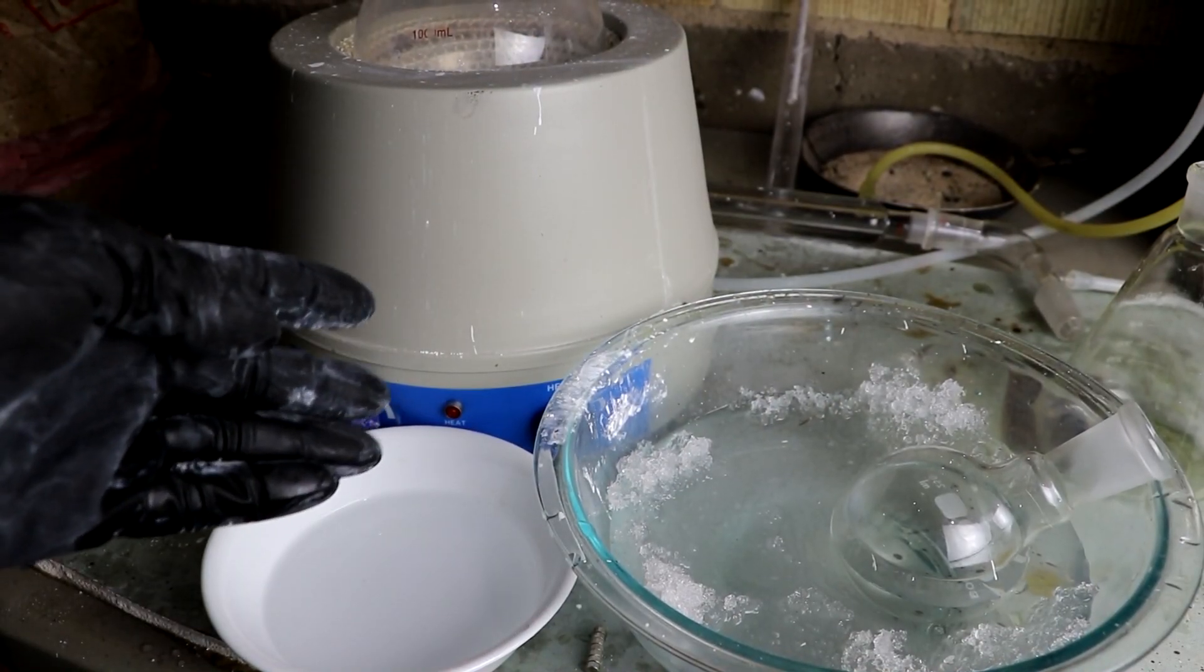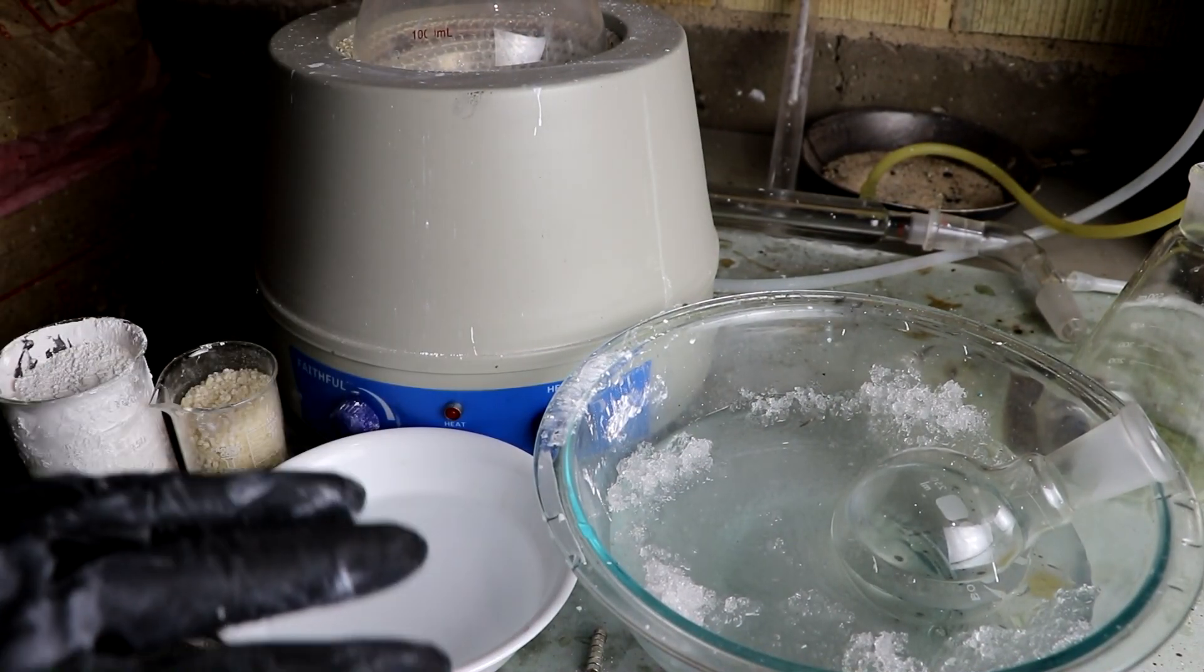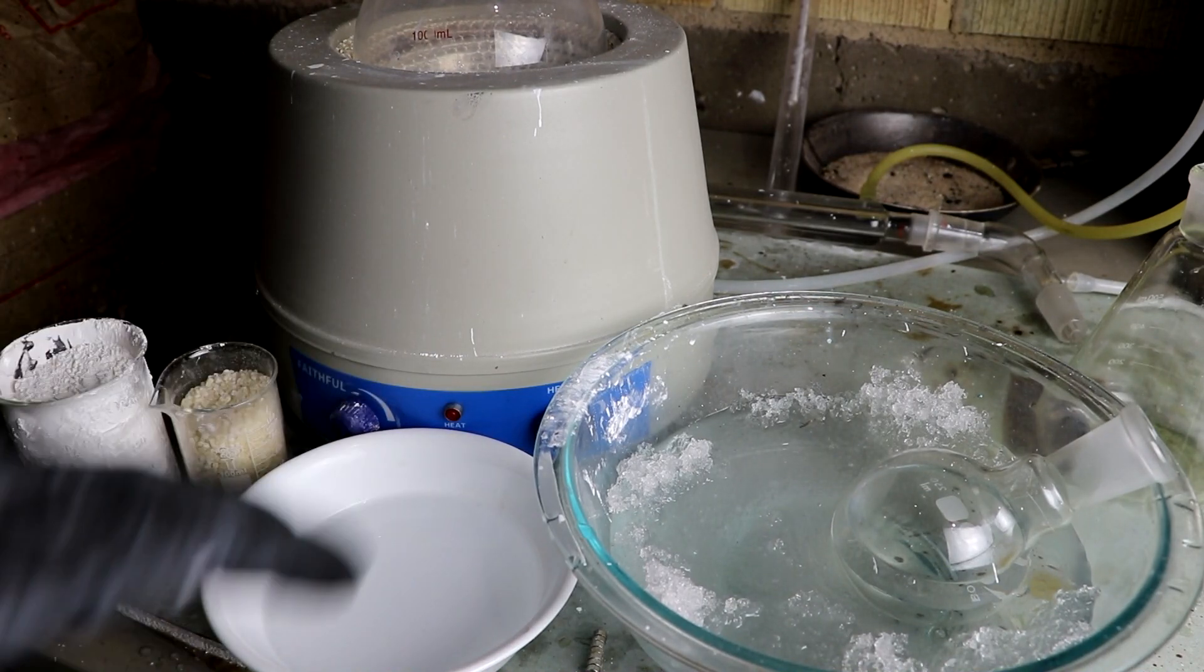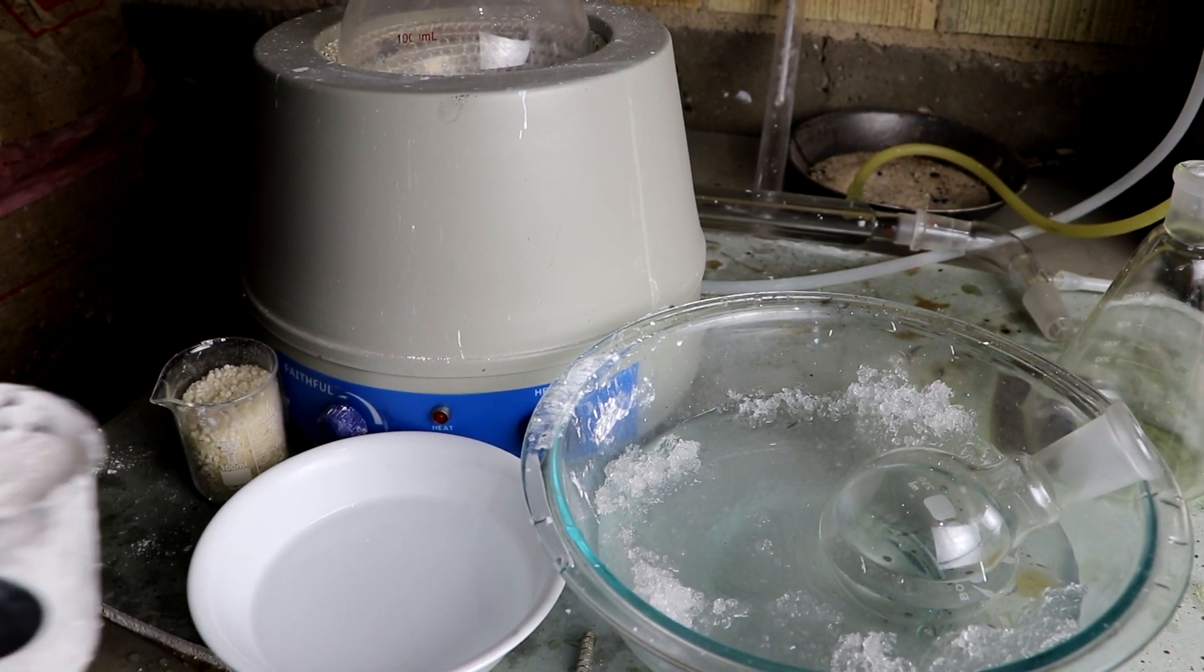Okay, so what if that small amount of calcium is causing your glass to streak or you want a stronger solution? Well, you're going to need some distillation equipment.